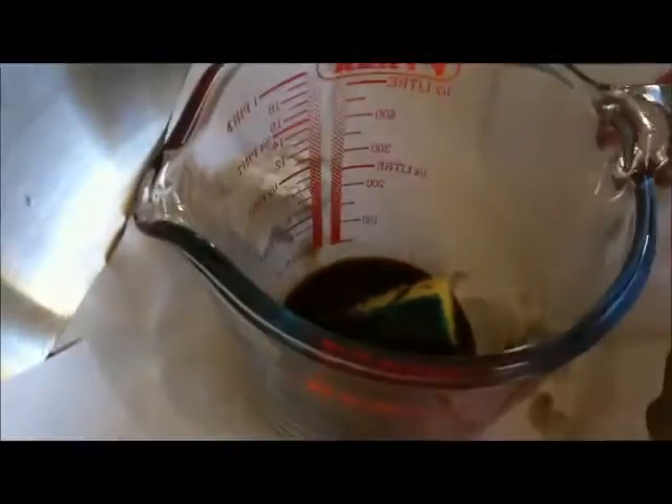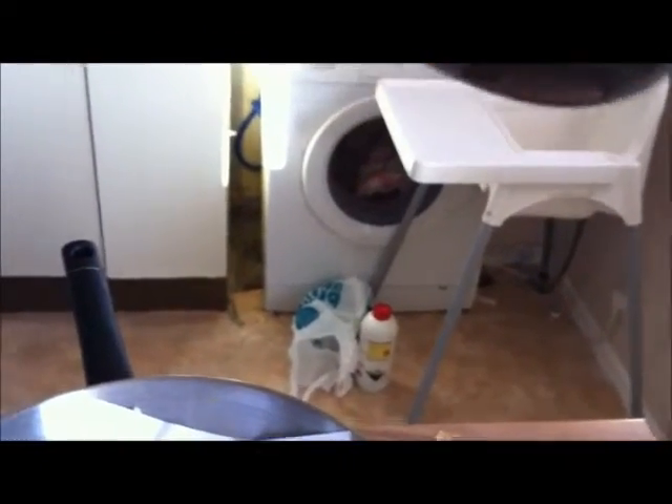As I said, I didn't use that much acid. Let me have a look - spin it round, just tilt this to get the sponge a bit more acid coverage there. Tilt it the other way.